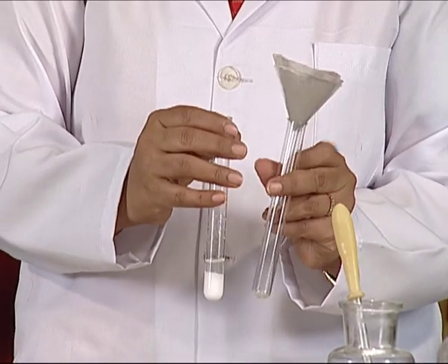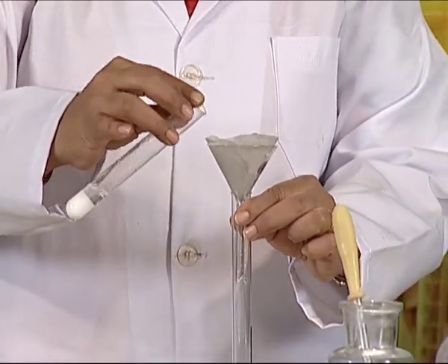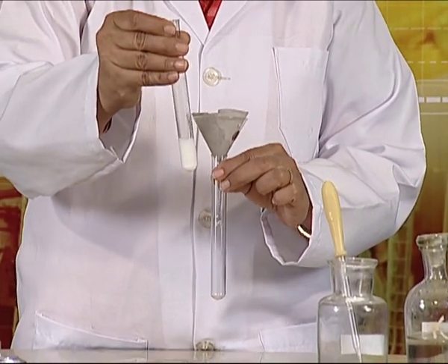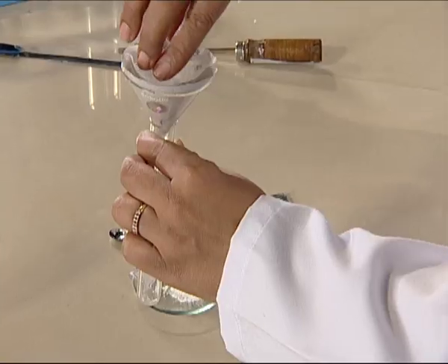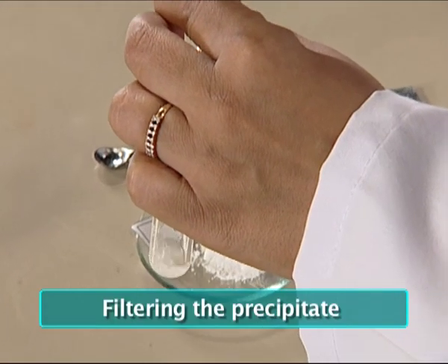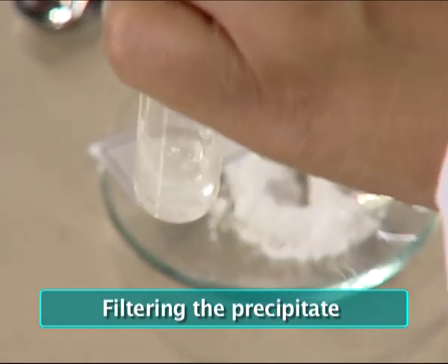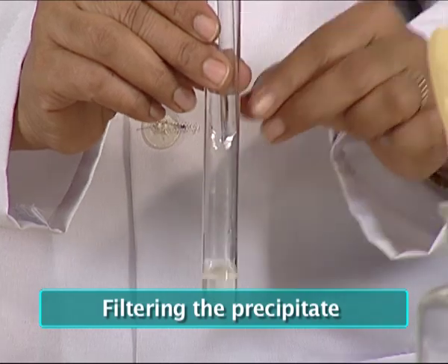Now, we confirm the presence of lead ions by performing another test. We will take another test tube and filter this white precipitate formed. We will filter this white precipitate using a funnel and a test tube.